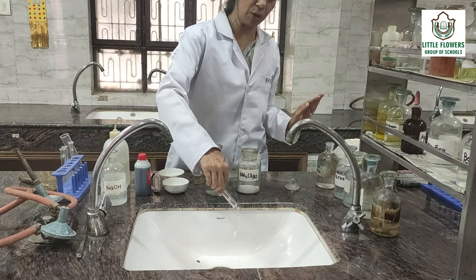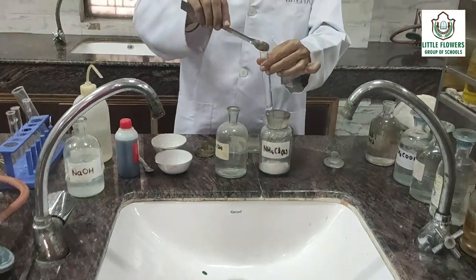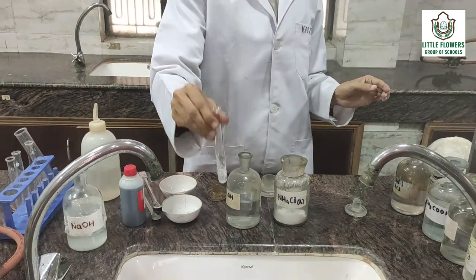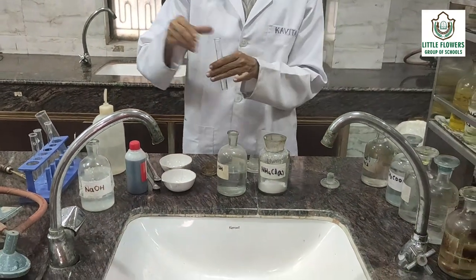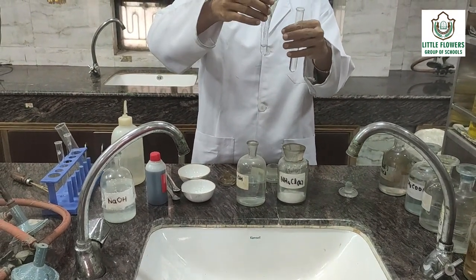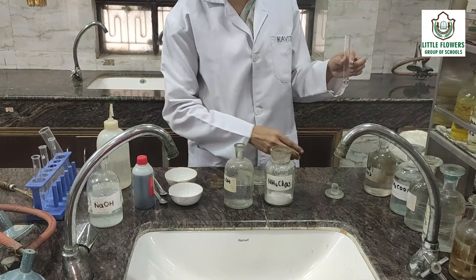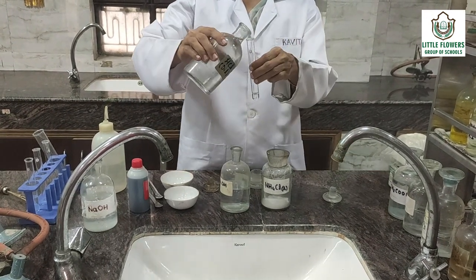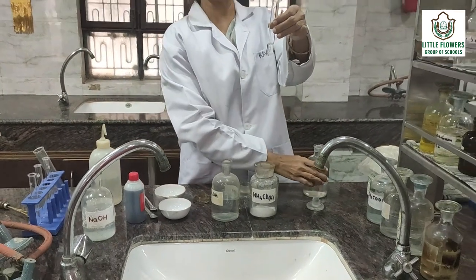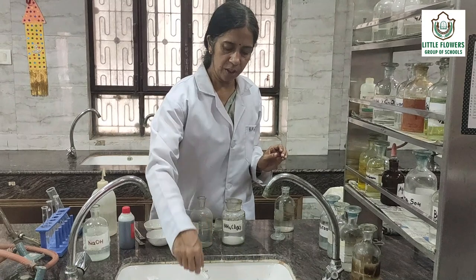Now again take the salt and prepare the solution. We have already prepared the solution; we will shift into it and add the Group 1 reagent, which is dilute HCl. You see, no PPT is there — it means Group 1 is absent. Now we proceed to Group 3.